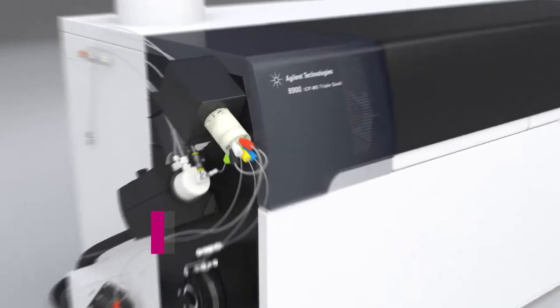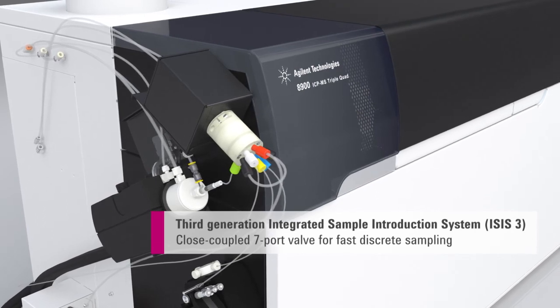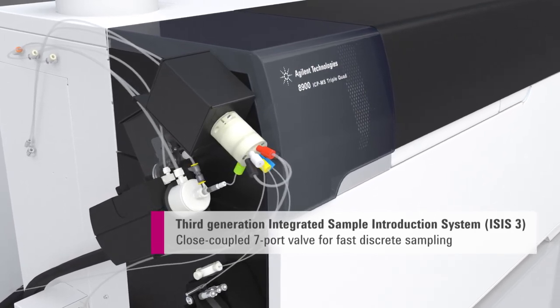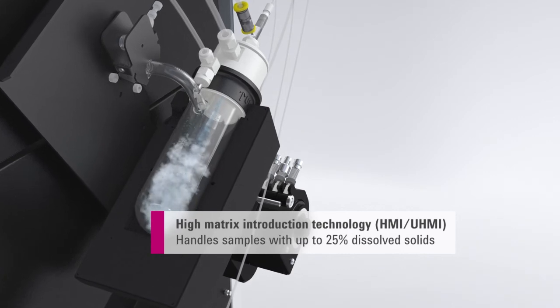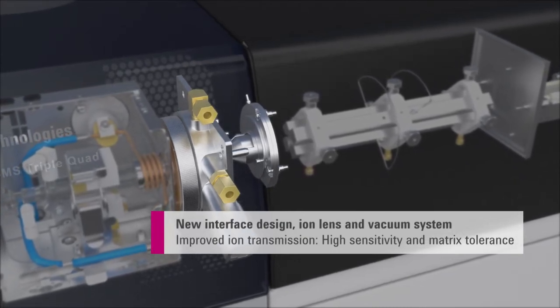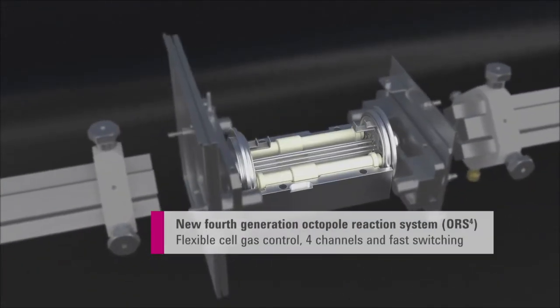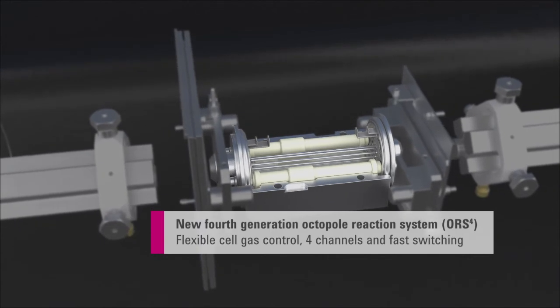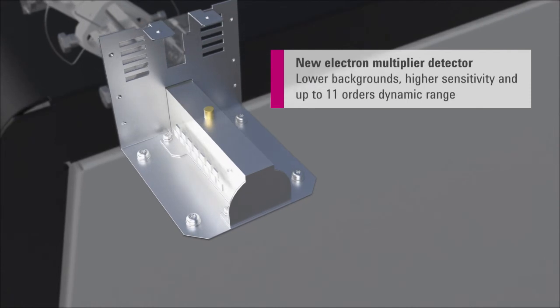The Agilent 8900 can be fitted with the ISIS III discrete sampling accessory, enabling sample-to-sample run times of less than one minute. High matrix introduction technology is included, allowing samples with percent levels of dissolved solids to be measured. The 8900 also provides high sensitivity and low background due to the robust high-transmission interface and ion lens, greater flexibility and faster cell gas switching with the ORS-4, and fast time-resolved analysis with up to 11 orders of dynamic range with the new detector system.